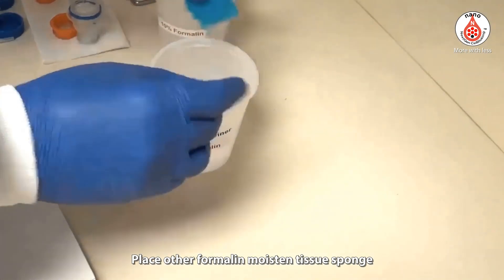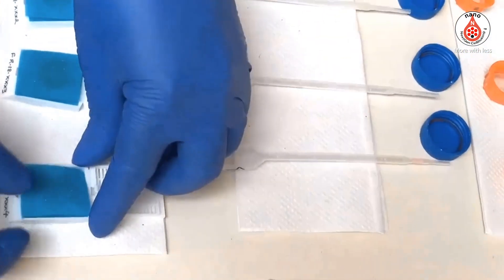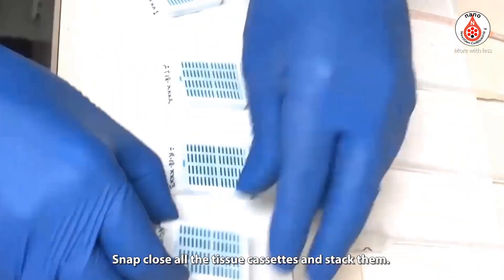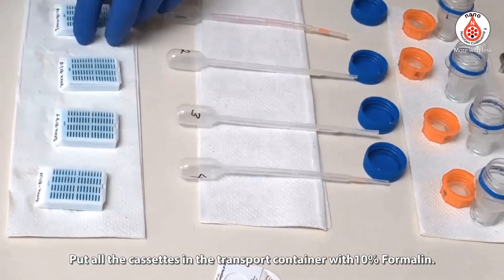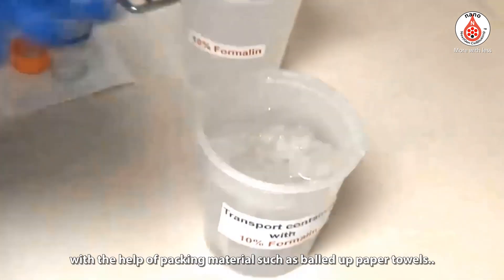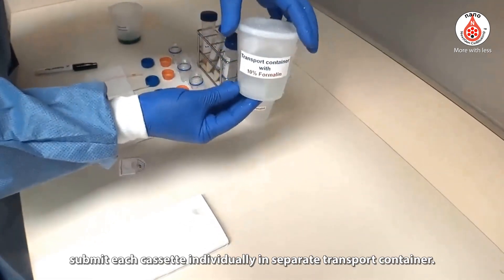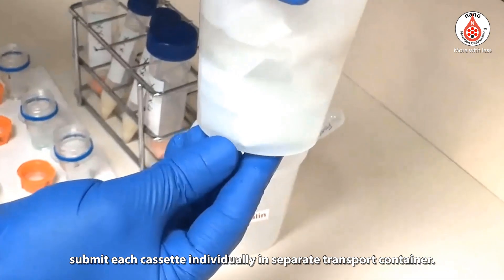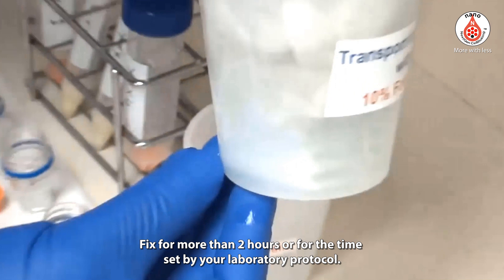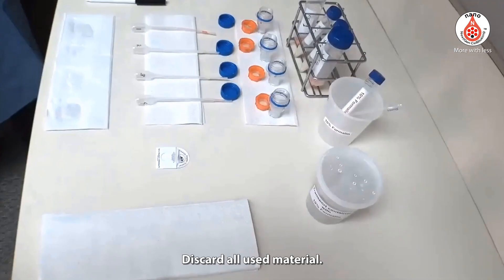Place another formalin-moistened tissue sponge over the tissue paper covers in all the tissue cassettes. Snap close all the tissue cassettes and stack them. Put all the cassettes in the transport container with 10% formalin, keeping all cassettes in horizontal position with bottom down, with the help of packing material such as balled-up paper towels. If contamination is a concern, submit each cassette individually in separate transport containers. Fix for more than two hours, or for the time set by your laboratory protocol. Proceed with histology tissue processing for paraffin embedding. Discard all used material.